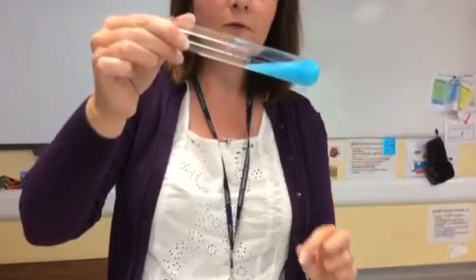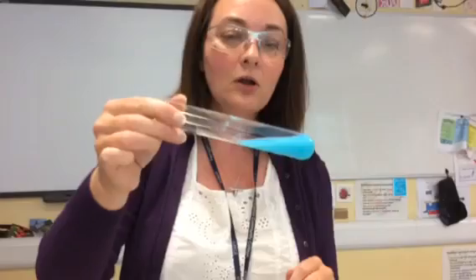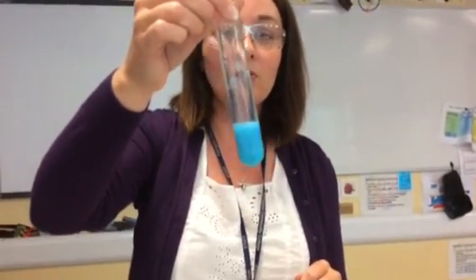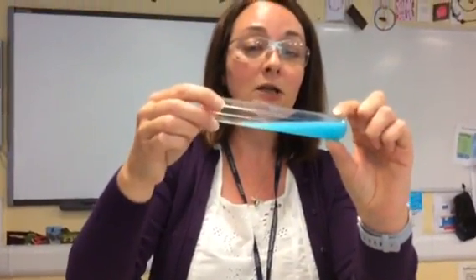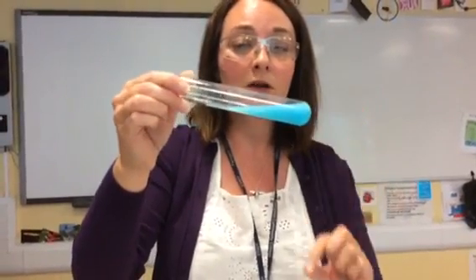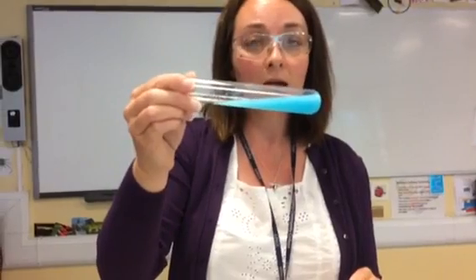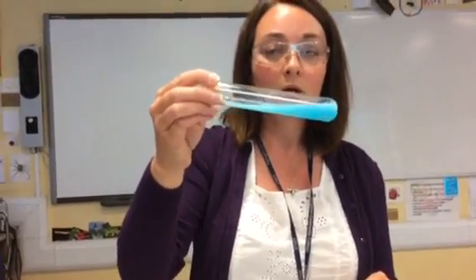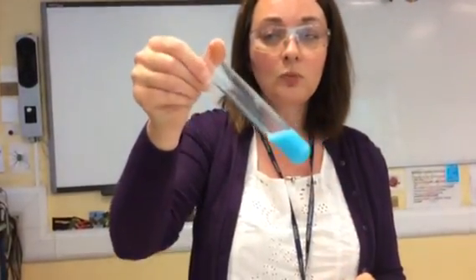So there's a name for this type of chemical reaction. When two solutions react together to form a solid, it's a type of chemical reaction, and it's got a specific name for this chemical reaction. So if you're not sure what it is, you might need to do a little bit of research and see if you can find out what this sign of a chemical reaction is when two solutions react together to form a solid, and we've got a solid forming inside our boiling tube here.